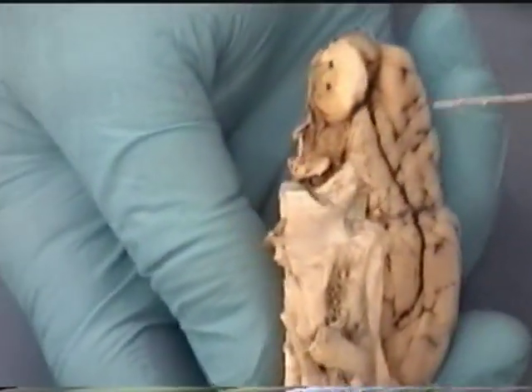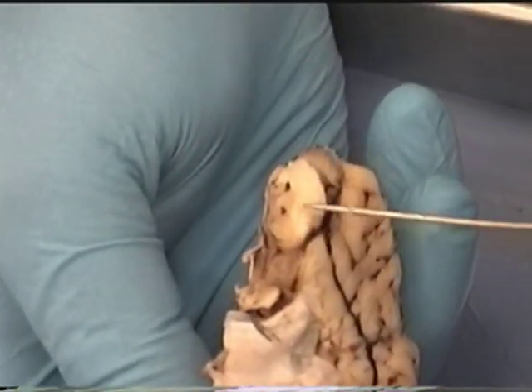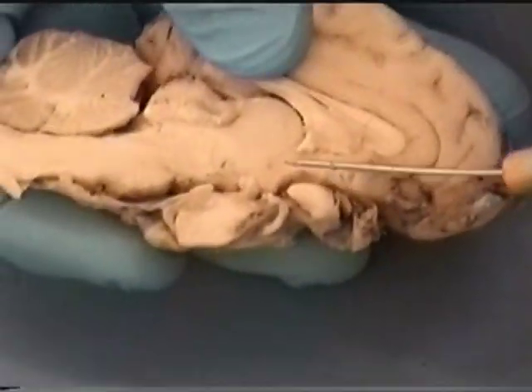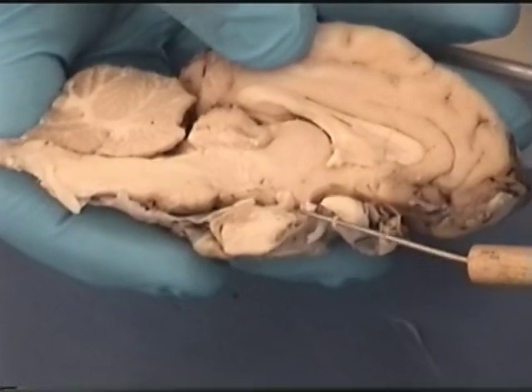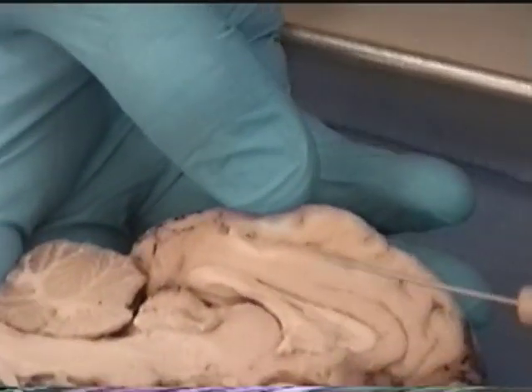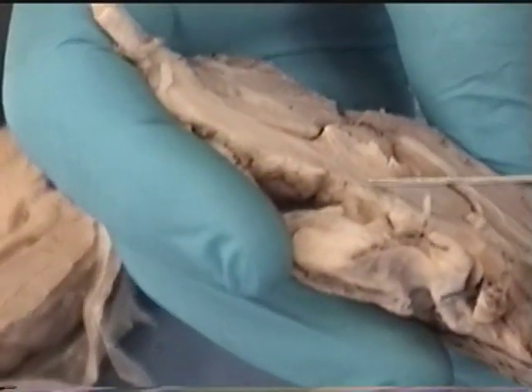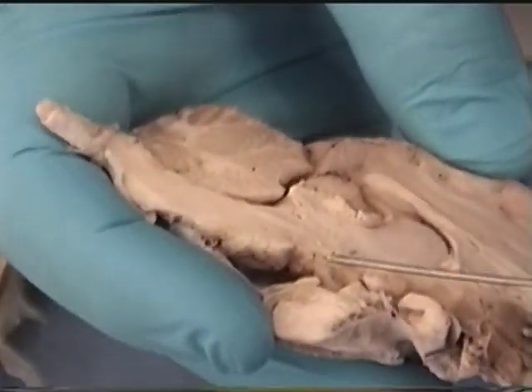Looking at the front of the brain, olfaction is very important to sheep, so the olfactory bulb on a sheep is actually much larger than ours, with a tract going back toward the brain. Suspended inferiorly off the brain is the pituitary gland, attached via the infundibulum — which has actually been torn here. Just posterior to the pituitary gland is the mammillary body. Ours are much more pronounced than the sheep brain's.